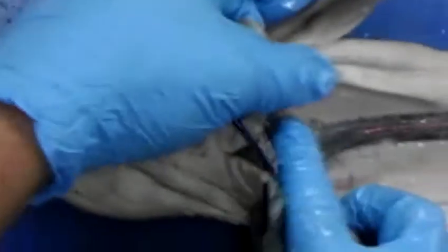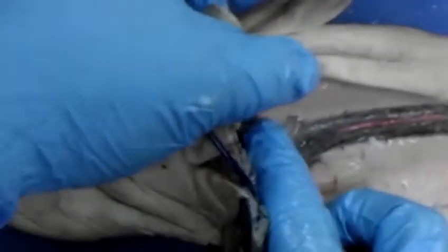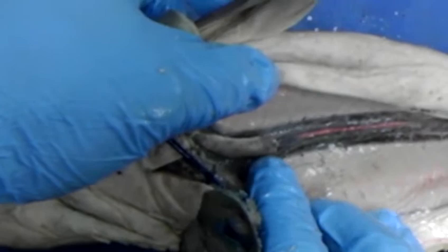Oh yeah. So getting past that, notice that we've got the testes up here near the throat region. Don't look for them here in the bony fishes. You can look for them here in the lampreys and the sharks. But where are they in the bony fishes? Tend to be lower, and then going on up to mammals, they're really low.